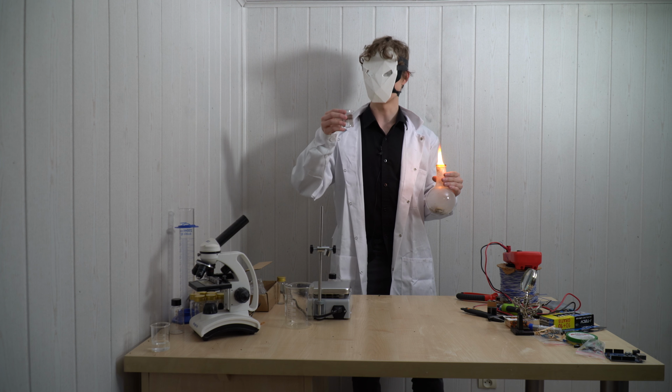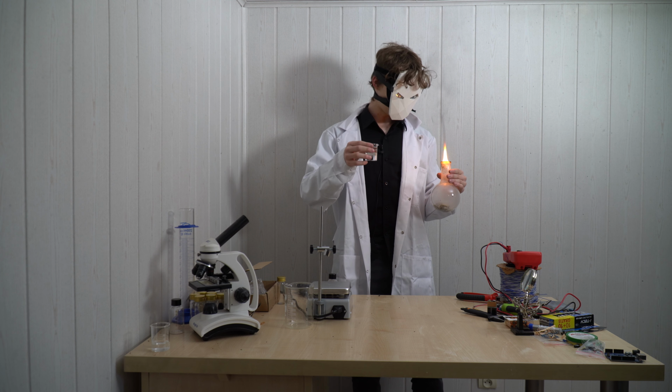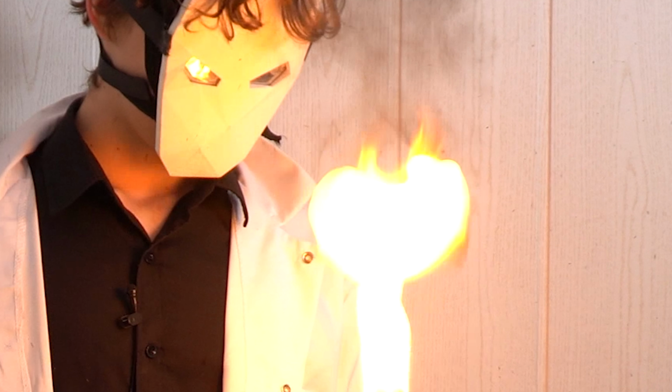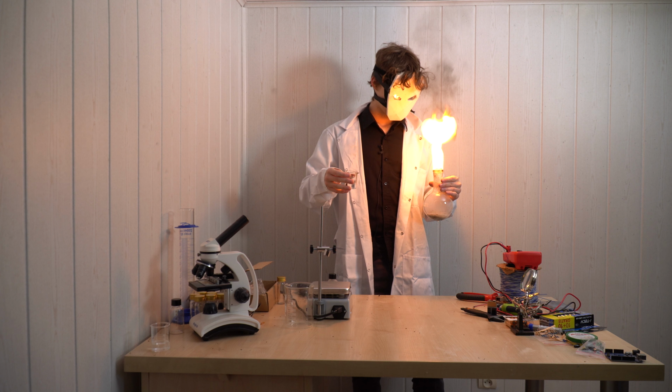I have some water, and we all know that the best way to put out a fire is to add water. So, what are we waiting for? Let's just add it. Hey, that's me. Now you're probably wondering how I got myself into this situation.